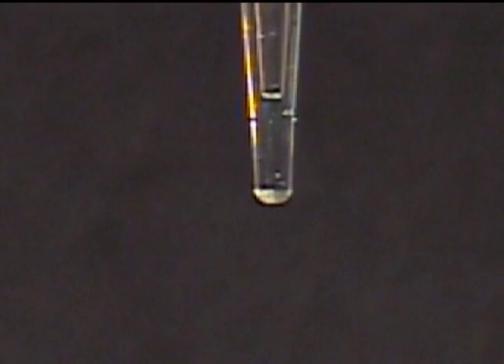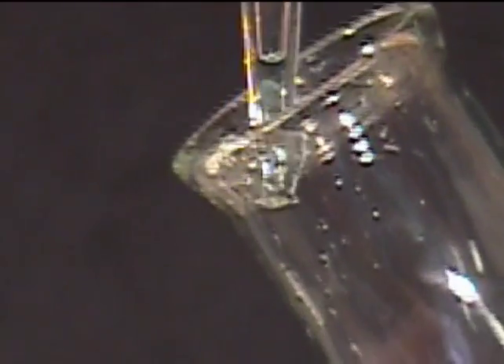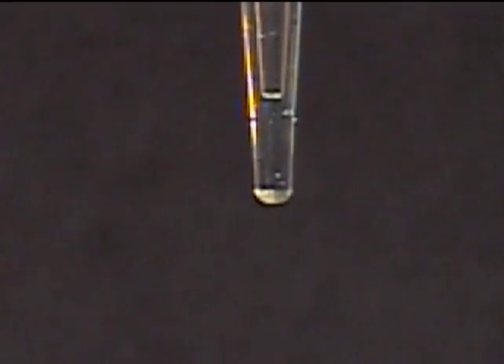Do NOT blow out the small amount of liquid at the tip of the pipette. On the side of the pipette you'll see the letters TD, which means to deliver. This means the pipette has been calibrated with the capillary residue in the tip factored in.